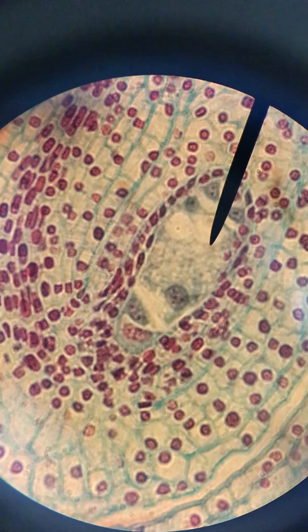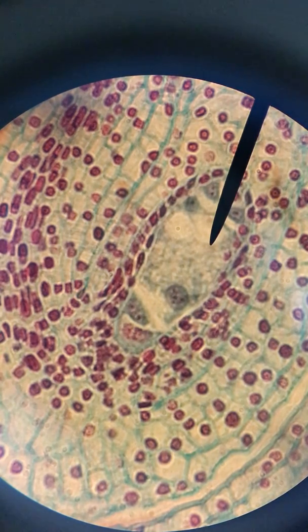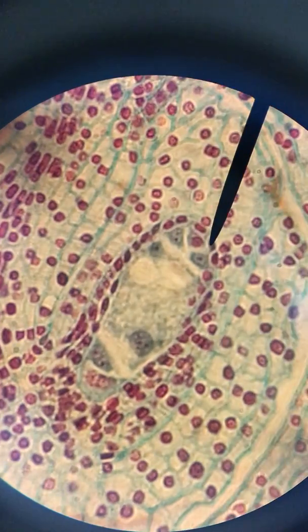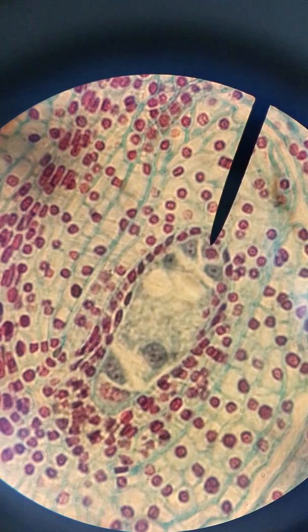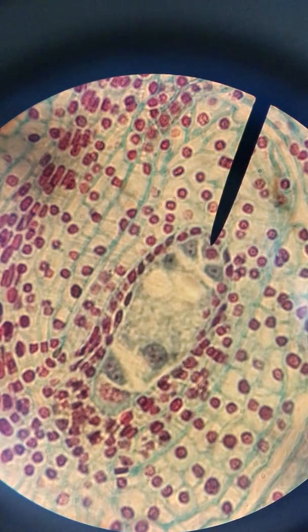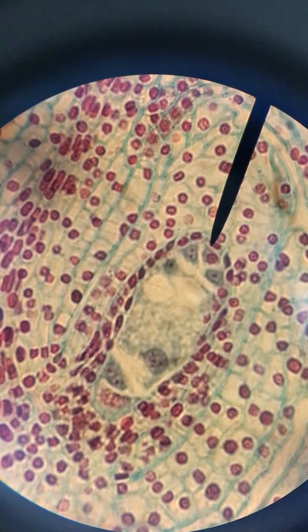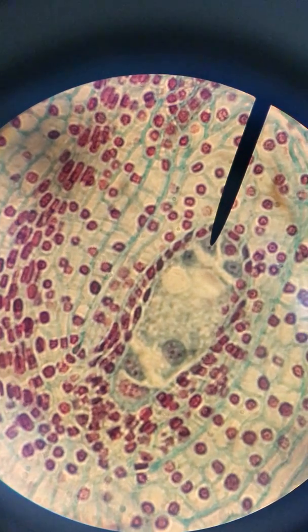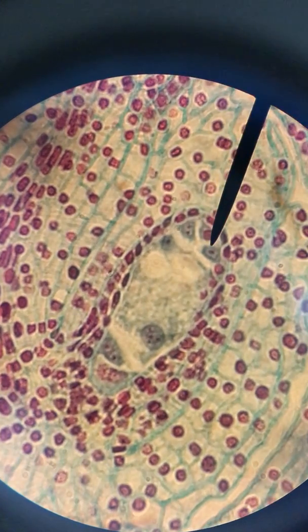Each of these nuclei have a specific name and a specific purpose. One of them of course will be the egg, and I'm going to hover over the one that I believe to be the egg. It is present usually at one end of the embryo sac and it is flanked by two synergids, which are two of the other nuclei. This is the egg, one synergid, and the second synergid.